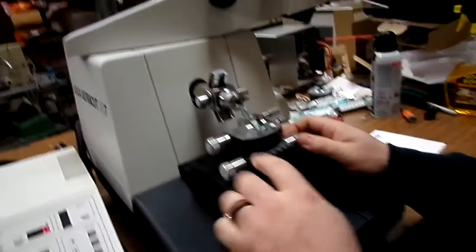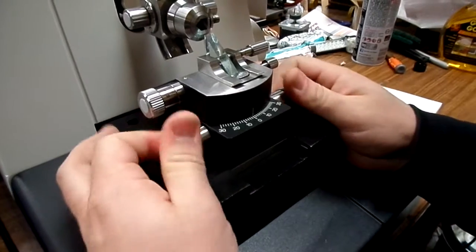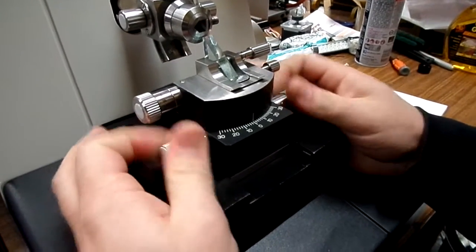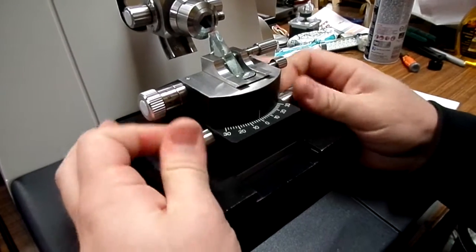Then you can also rotate it to a certain degree with these. It's a very slow adjustment, but it gets there.